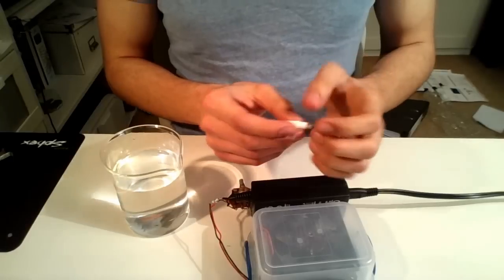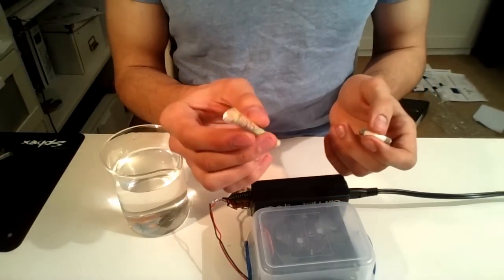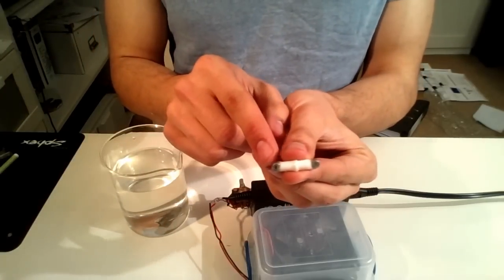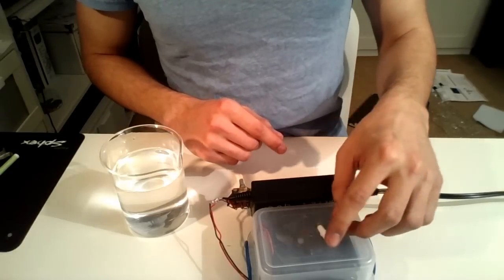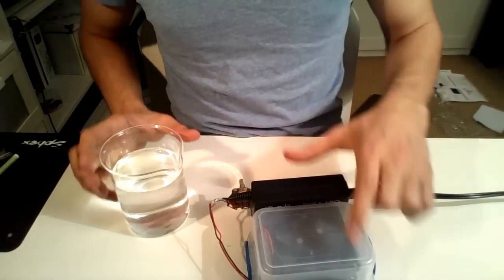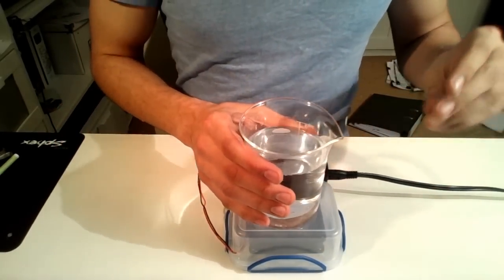And for the stir bar, what I've done is I've taken the tip of this pen and glued two of those magnets that we saw earlier, just on either end. Got to make sure you get the poles right, otherwise one could stick and the other one will stick up and won't work. Kind of annoying to have to re-glue it all, which is what I had to do. And just give her a test spin.